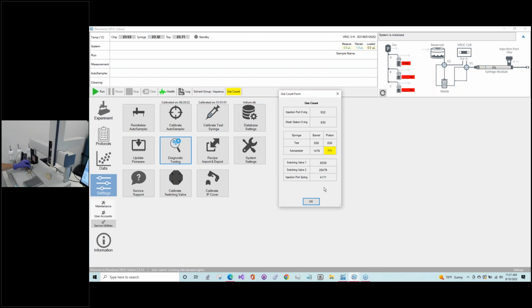And to get it fully seated after you put the new one on, you'll want to go back to that low-level tab in the diagnostics section, and then open and close the injection port cover a couple of times to basically force that back in proper position. The second O-ring, and hopefully you can see here, is in the wash port. And so it's a larger O-ring around the base here where we do the inside of the syringe cleaning. And to change this one, just to make things fast so you didn't have to watch us deal with all the screws, there are four screws here that keep this wash port base in place.